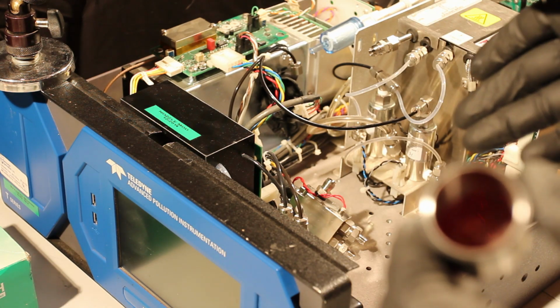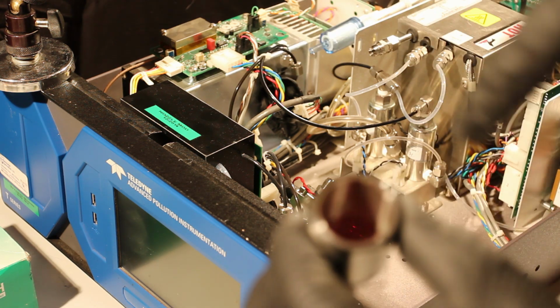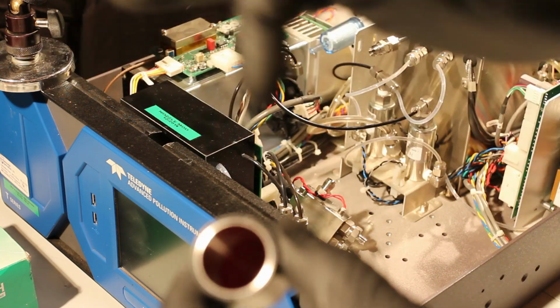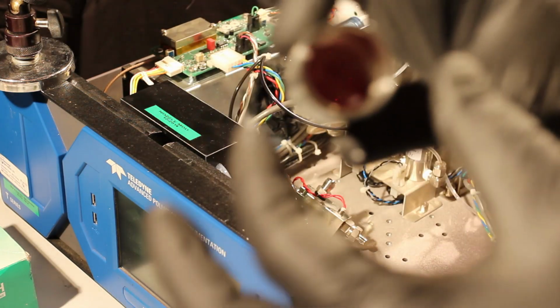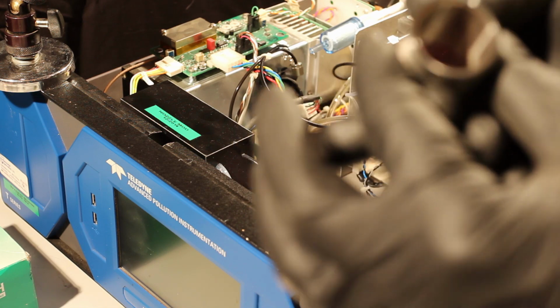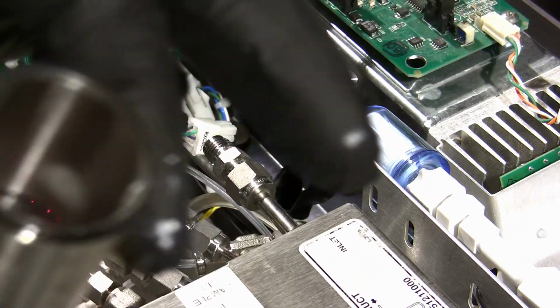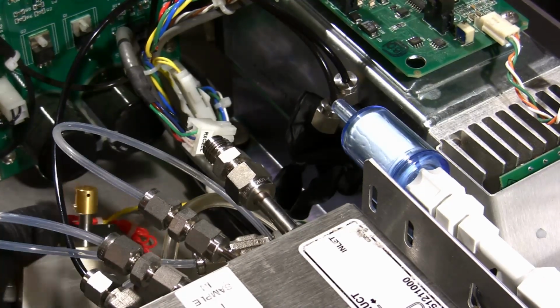Now this one has the nozzle modification that directs our flow out as it comes into the chamber. So rather than coming straight in at the infrared window, it directs it out, which gets the buildup along the sides of this chamber wall. That improves the life in the time between cleanings, but it doesn't eliminate it. If you're able to see in there, actually let me try it over here. If you can see inside there, you'll see there's a little bit of debris. It's dirty. That's our goal today, is to clean that out and to clean any surfaces here that we see.